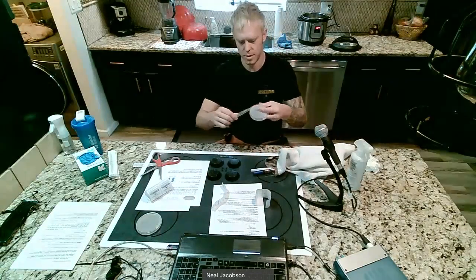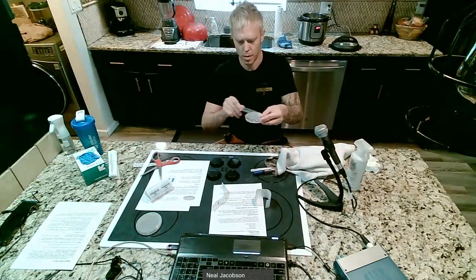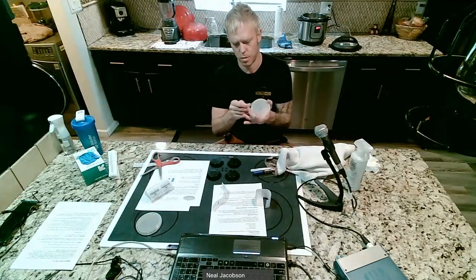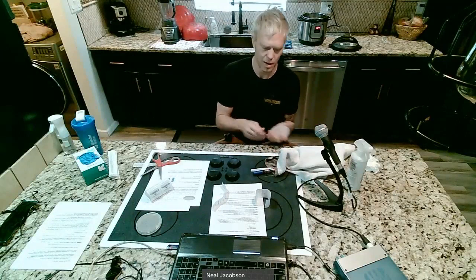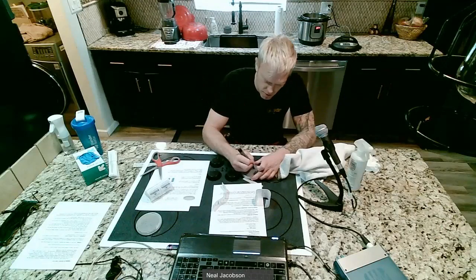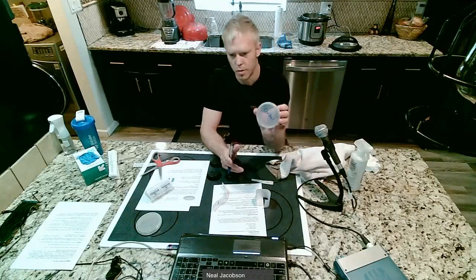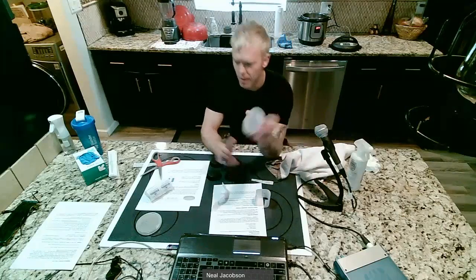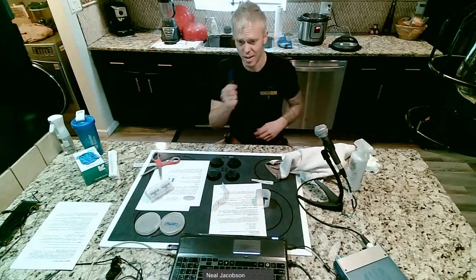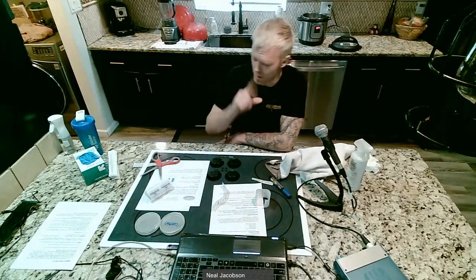I'm just going to seal it with our parafilm all the way around the border. Nice and sealed up. No air in or out. And this time, not on the bottom, but on the top, I'm just going to write control. So I just wrote control on that, and that's just going to go off to the side. At the end of this, I'll tell you why we did that, and it will make perfect sense to you.